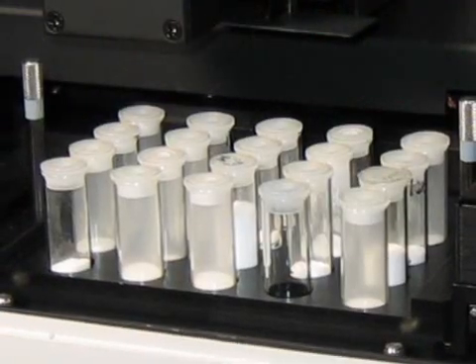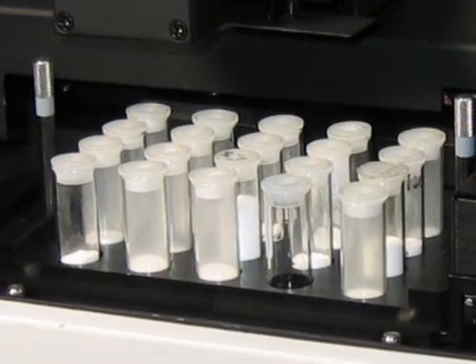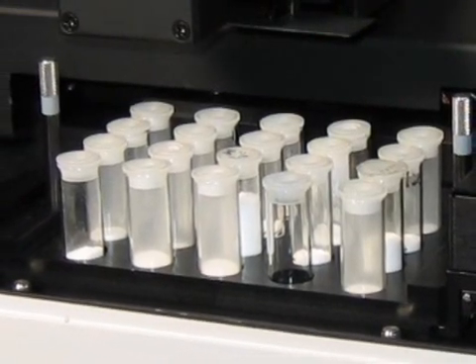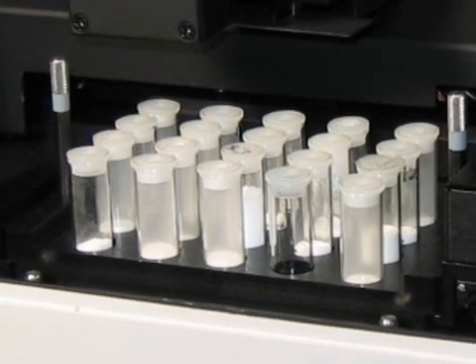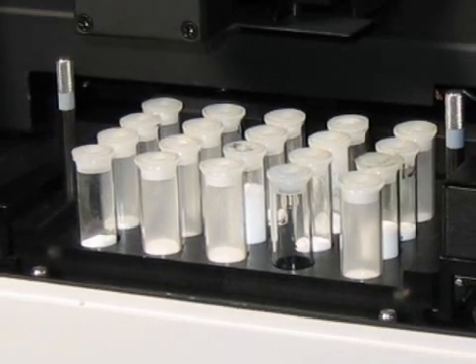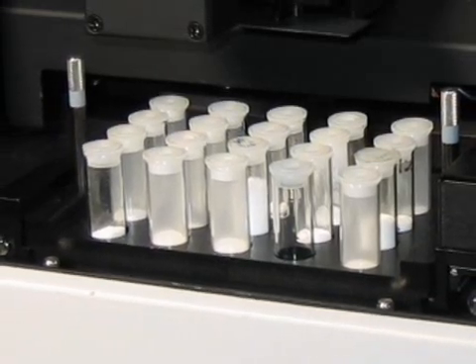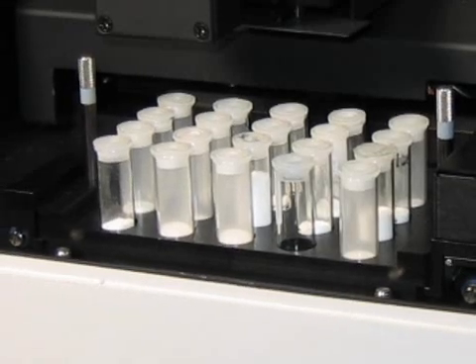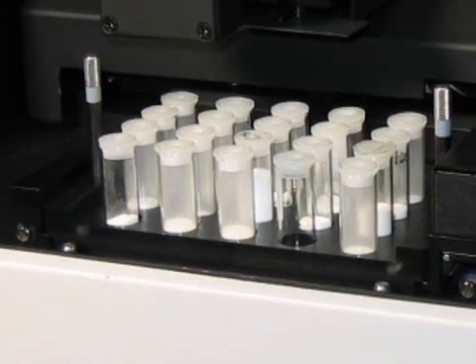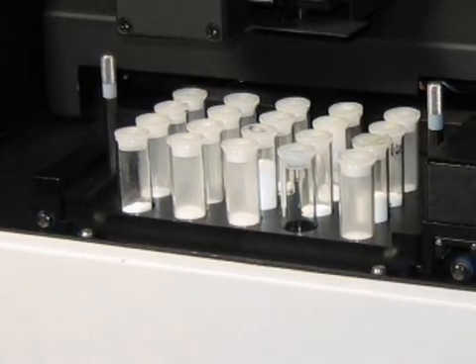Laboratory methods for tablet assay and content uniformity are usually time-consuming. They are routinely done by HPLC, which requires lengthy calibration runs, mixing of buffers, and procurement and disposal of volatile solvents.